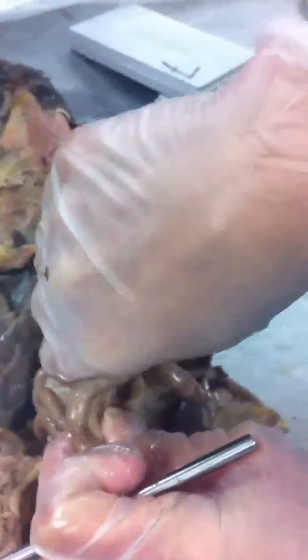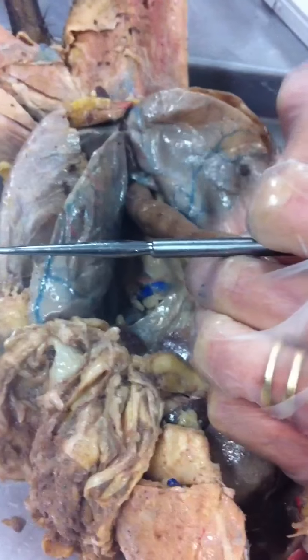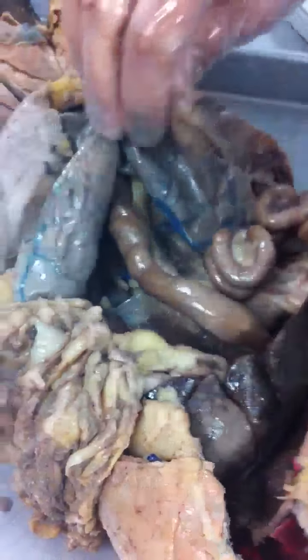Intestinal mesentery. Why are there so many blood vessels? Because they are getting nutrients. Absorbing nutrients, right? Absorption is the key function here. We also had a connective tissue holding the colon in place, and this is called the mesocolon.